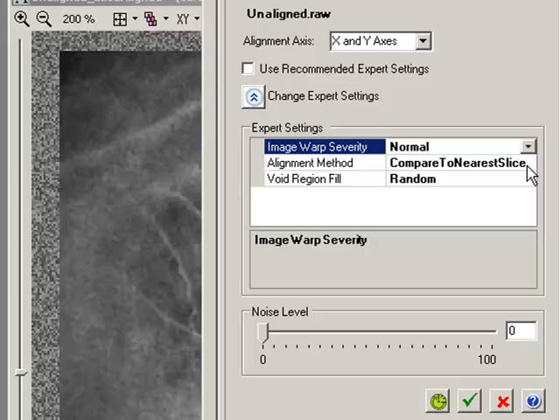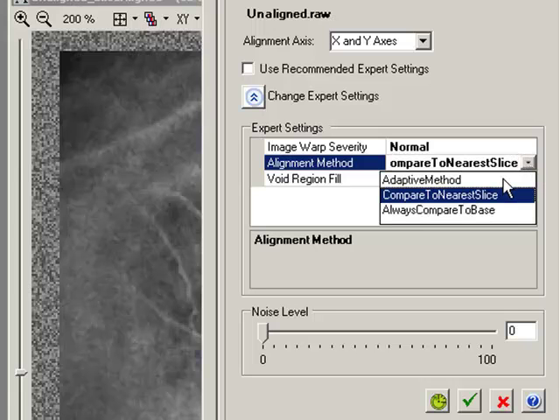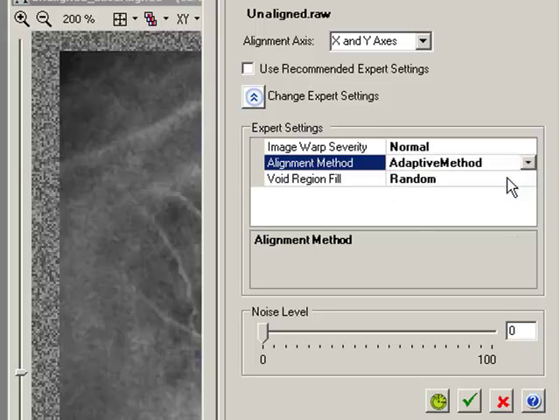Alignment method it's given us here, compare to nearest slice. This is an alignment method which takes each slice and compares it to its neighbours and performs the alignment based on that. Okay. Actually we may be better off using an adaptive method here. This basically looks at every slice in the stack and decides which one has the best cohesion with the other ones, which one is the all-round best aligned one, and then it bases the alignment of all the other slices compared to that slice. Okay.